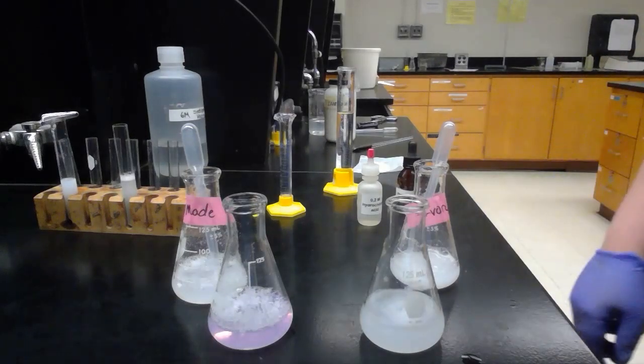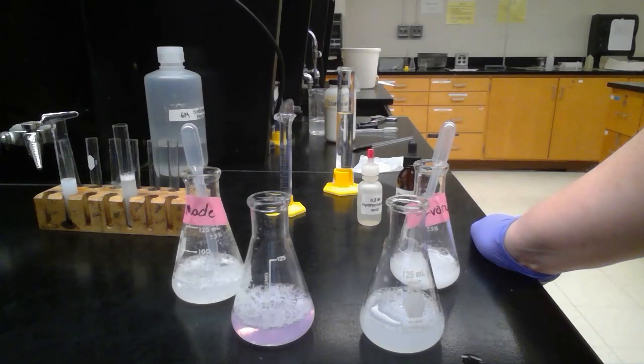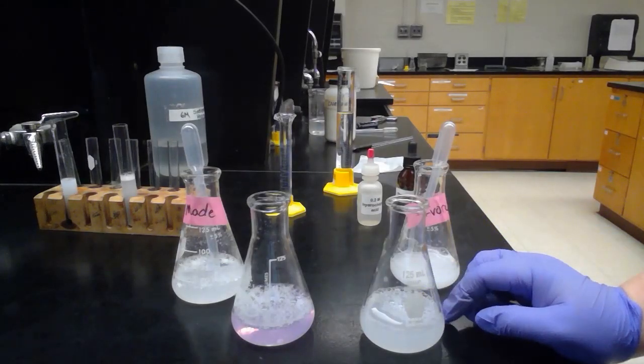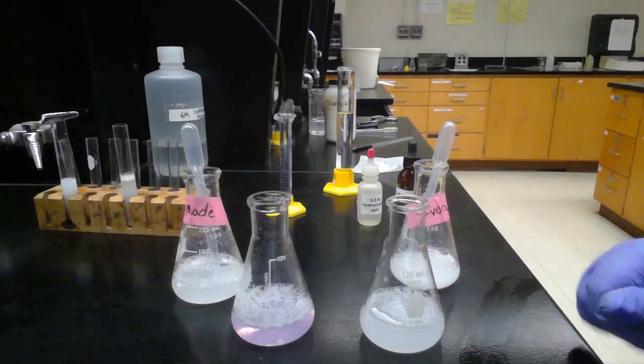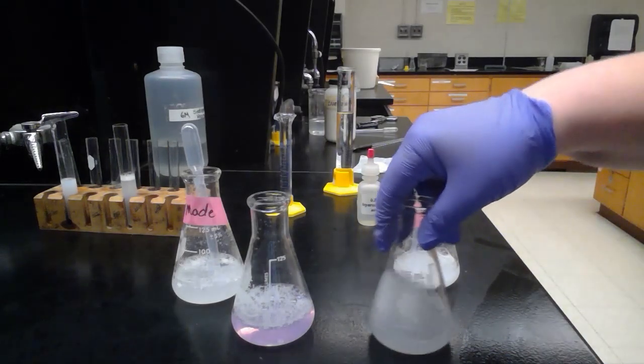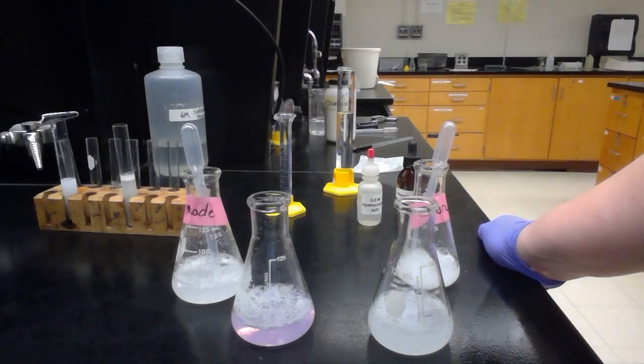You can see with the made soap that we have there is a slight base value for our pH or slightly alkaline, and that's what we get in that pink color. The ivory soap, however, because it is an older soap, it's been processed and ready for market, does not have that alkalinity and so it is neutral. Its titration is complete.